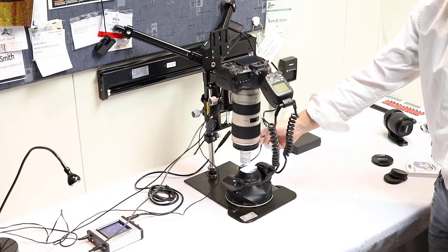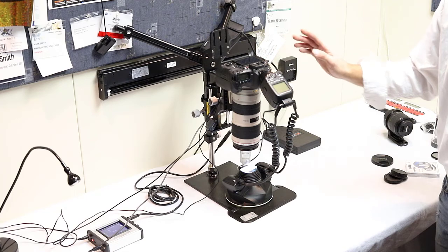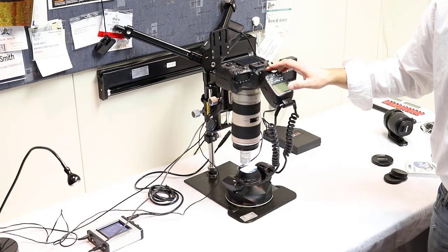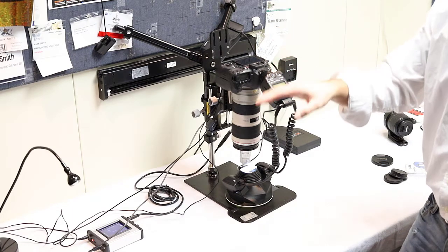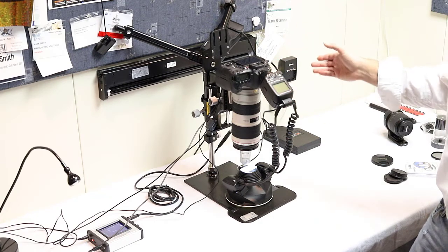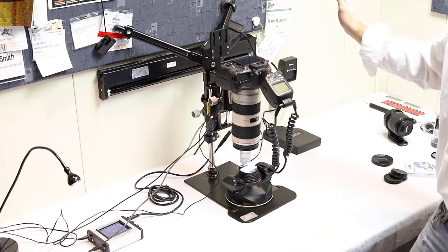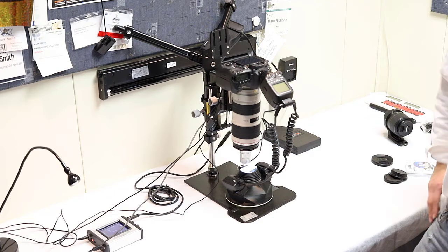If you start increasing objectives, you're going to have to increase the output of the flash. If you find that you've gone up to 1/8, which is about the most we want you to go on these systems, then it's time to start increasing ISO on your computer. So if you're at 50x, the image is still dark at 1/8, then you want to turn to your computer and change the ISO from 100, start elevating it to 400. All of the other settings stay exactly the same, and that's how you're going to be shooting slides.